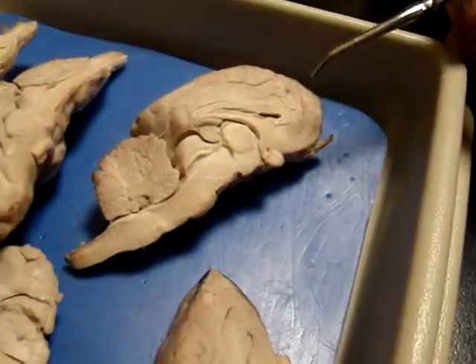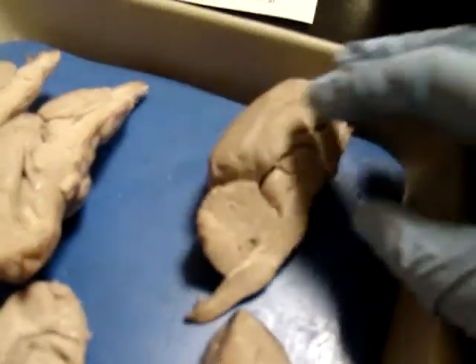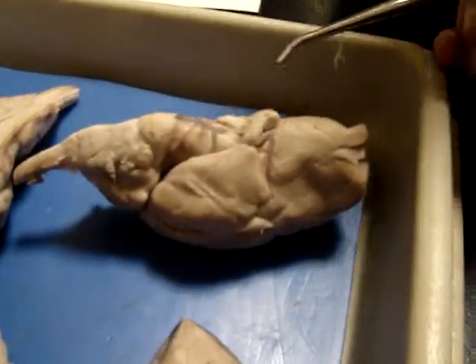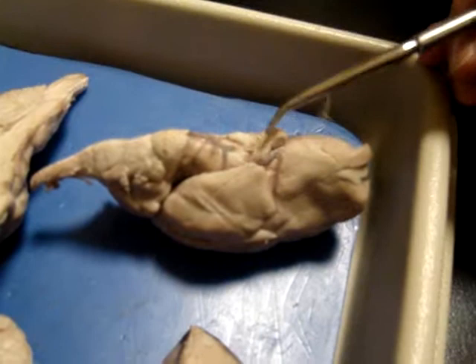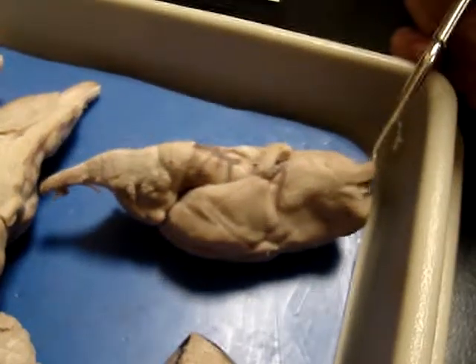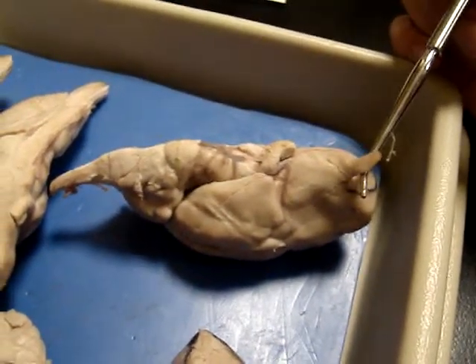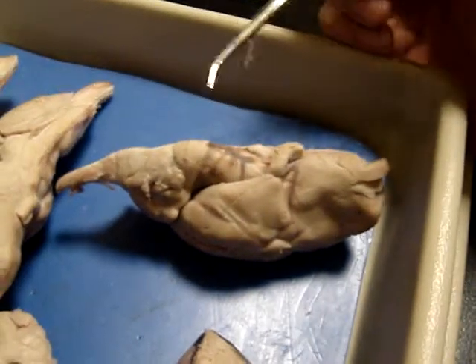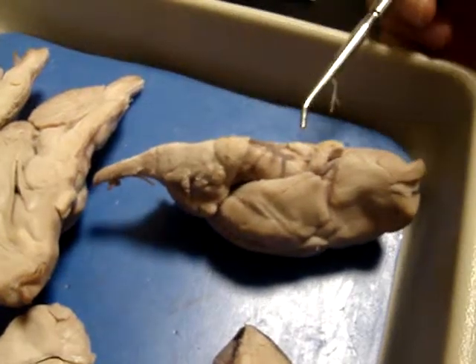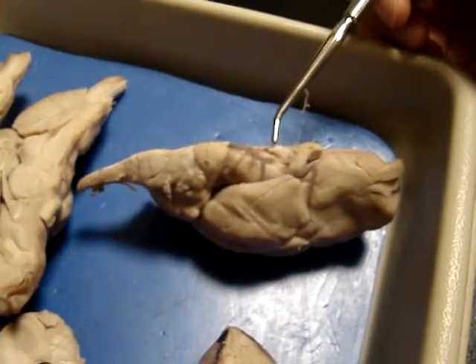Was there anything else that I'm missing? We can look at the ventral view, actually. Okay, so everyone should be able to identify the optic chiasma. You've got your nice big X here, which goes off to your optic nerve, and then we have olfactory. People kind of identify this bit, it's cut in half. We also should have the mammillary bodies in here.